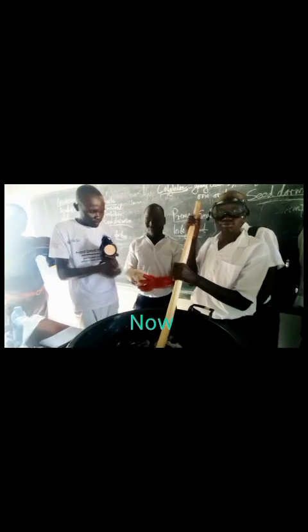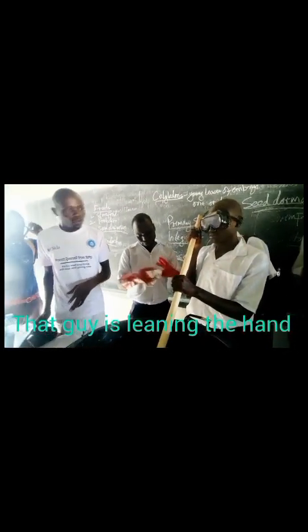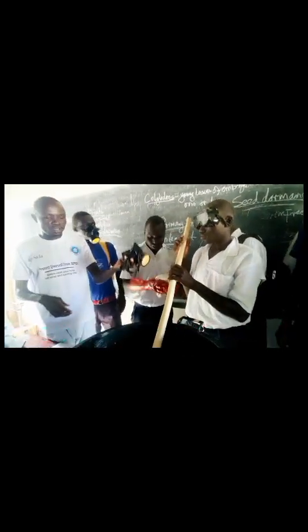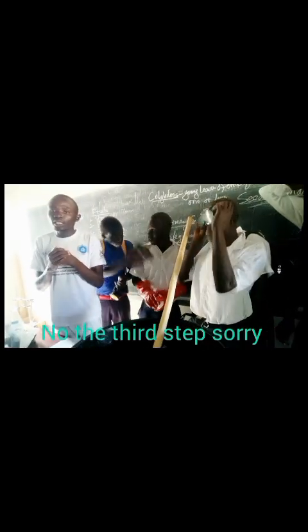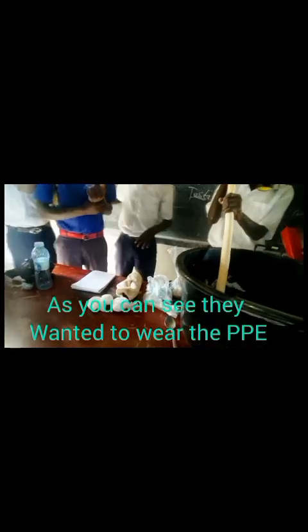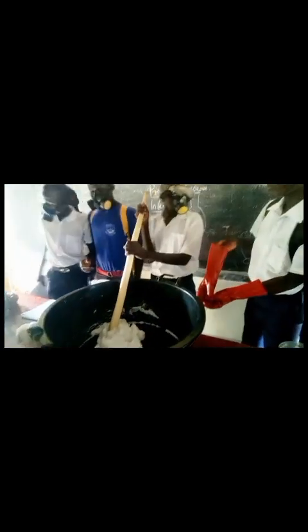Now that is the wiper. That guy is cleaning his hand, because some of these things are harmful to the body. Now we are getting another member to carry out the third step. As you can see, they wanted to wear the PPE. So they are still stirring.